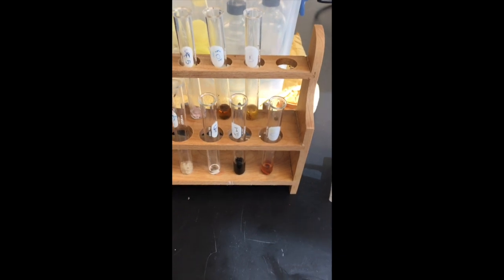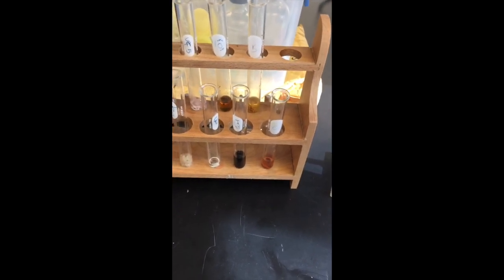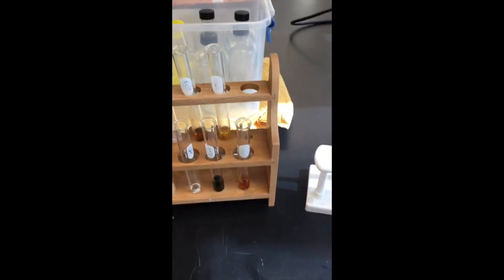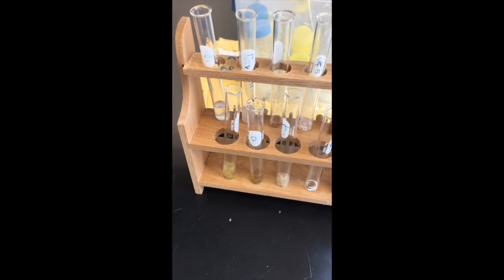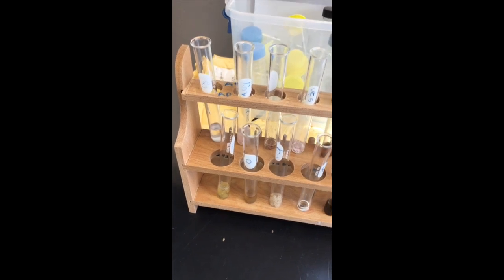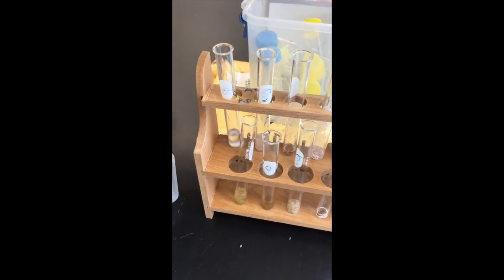The one for complex carbohydrates went extremely well. The bread registered, wow, there's complex carbohydrates everywhere, but not so much with the cheese, or with the chocolate chips, or with the salami. The protein test failed, pretty much probably because there's something wrong with our indicator chemical, but further research is necessary in order to figure that out.